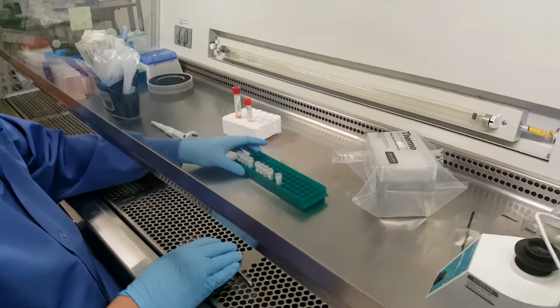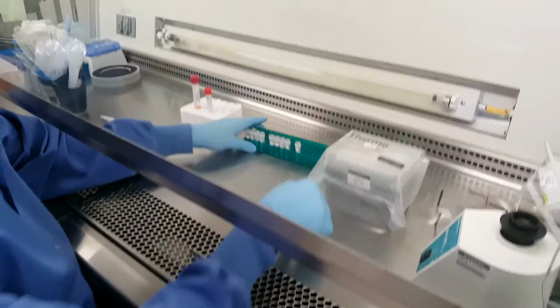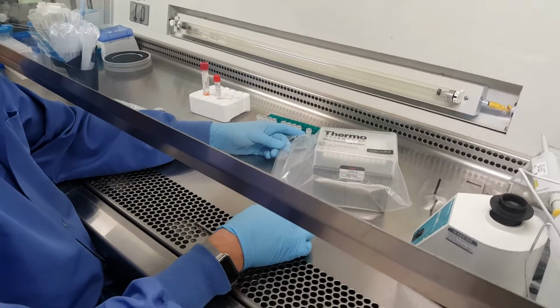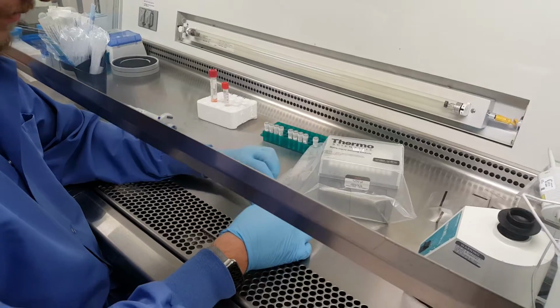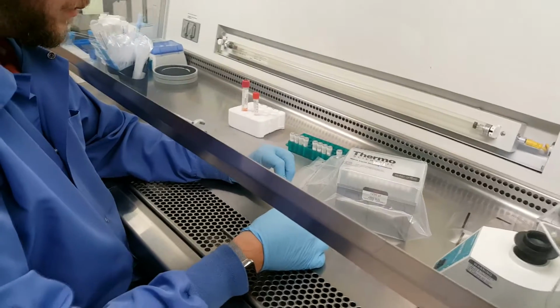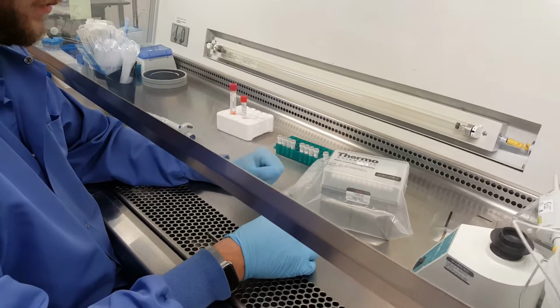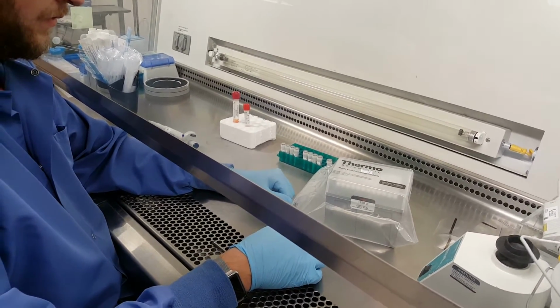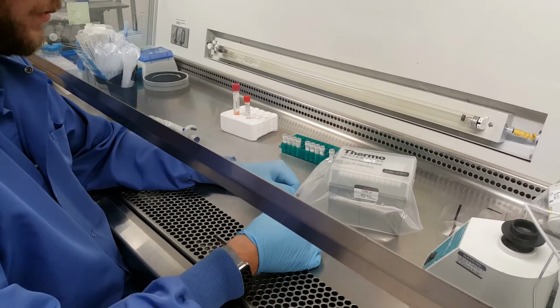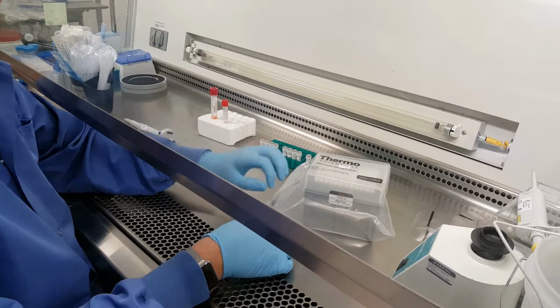At this point, 1 minute has elapsed, and we'll now transfer 1 ml from the 1 ml tube into the 3 ml tube. This gives us the ability to make the number of aliquots that are required. To do that, you can use either a sterile transfer pipette or one of the 1 ml pipette tips. You are removing 1 ml of liquid out of there. These are the extra long tips so that you can get down in.